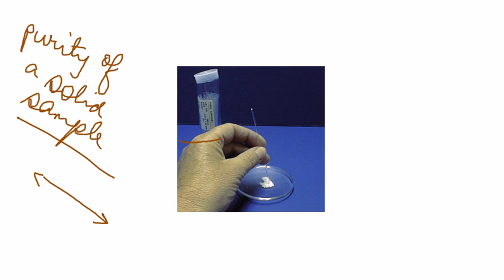What I mean by that is that the entire morphology that one expects when a crystal tends to shrink, sag, and melt, that entire process, which for a pure sample is supposed to take no more than 0.5 to 1 degree Celsius, if your product is an impure sample, is going to take like 5 degrees Celsius or even as high as 20 degrees Celsius, depending on the amount of impurity present for that particular sample.